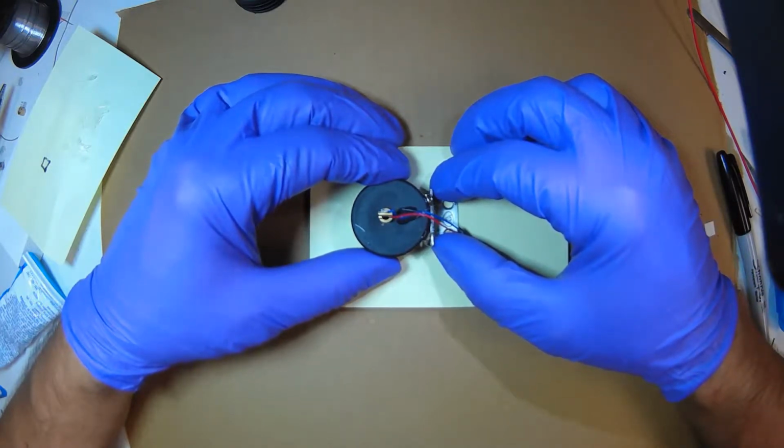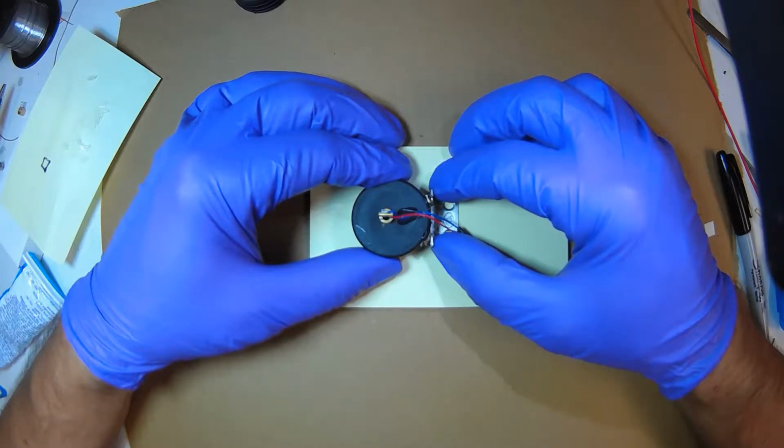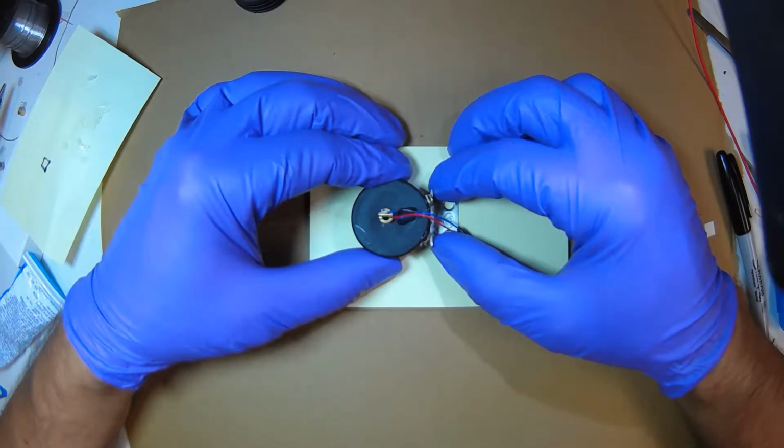Hot glue is kind of nice. It gives you a little time to fix your part, and it hardens pretty fast, so you don't have to hang out for like five minutes with epoxy. So I'm just letting it harden, and because I'm on a flat surface, both the hinge and the bottom of the cylinder of the cap are on the same flat surface, so they'll lie flat on the box when we get to that point.